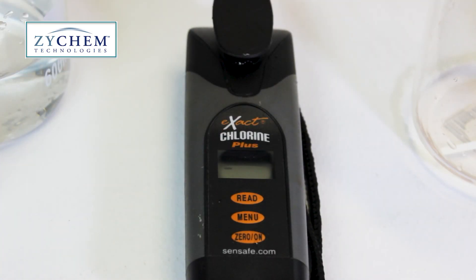Wait a few moments and then the unit will flash and display the calculated test reading. This is showing 0.22, so in this water sample there's 0.22 ppm of free chlorine.